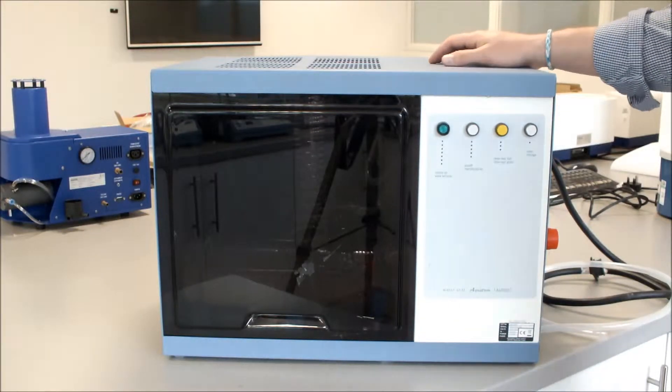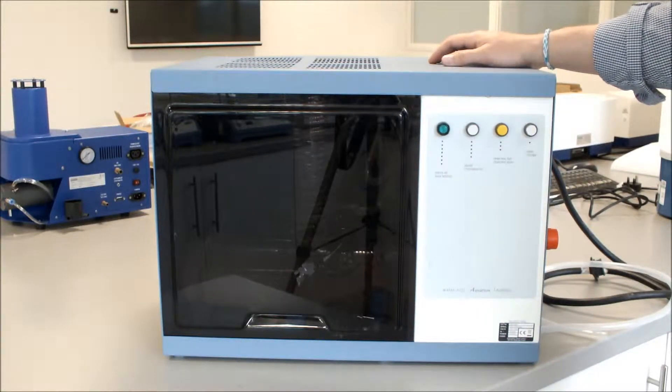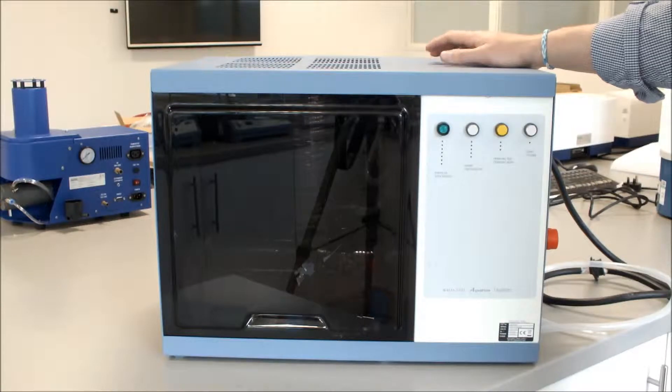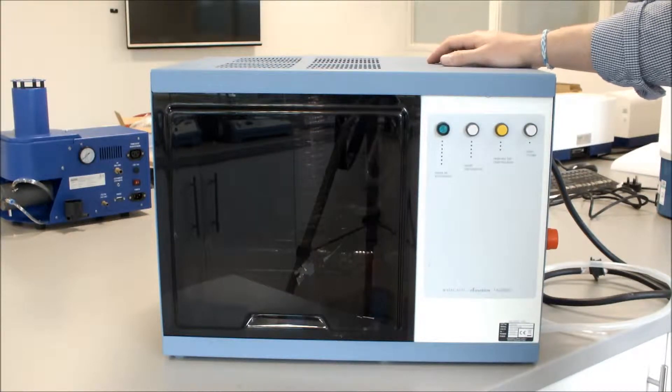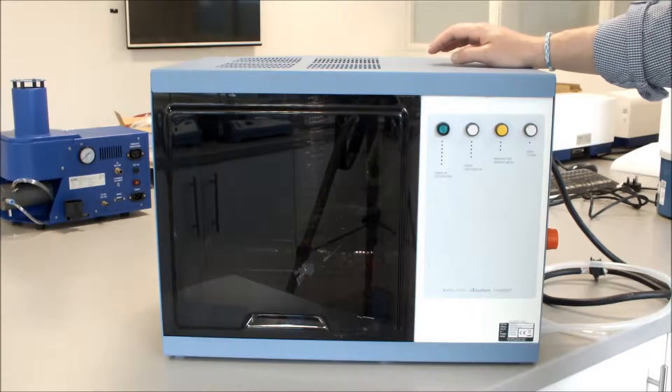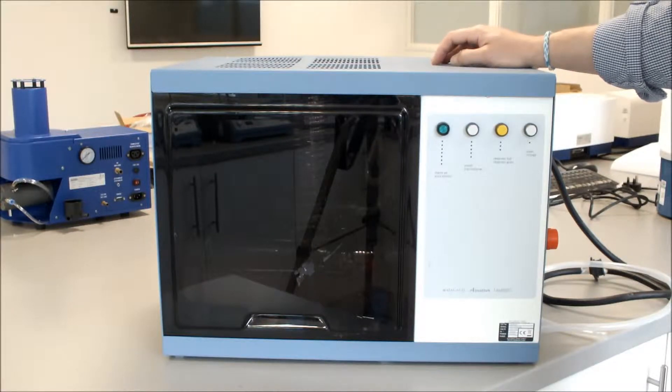This video is about the installation of the A4000D-WCK water conversion kit to the Stuart Aquatron A4000D water still.